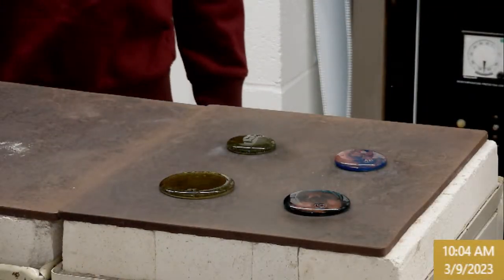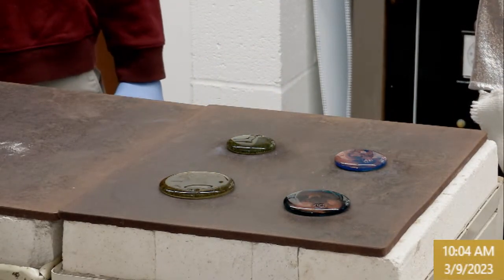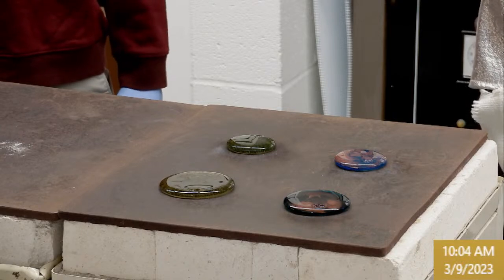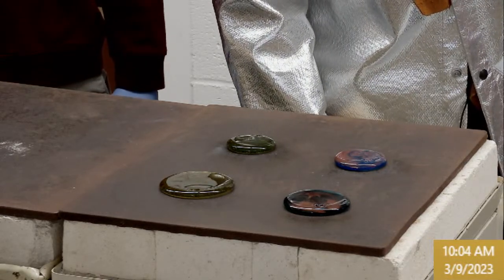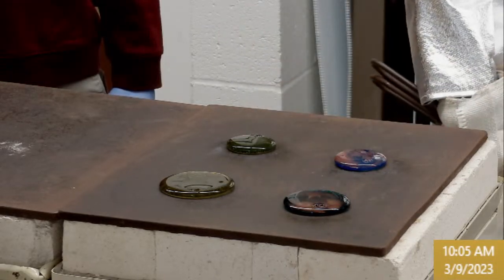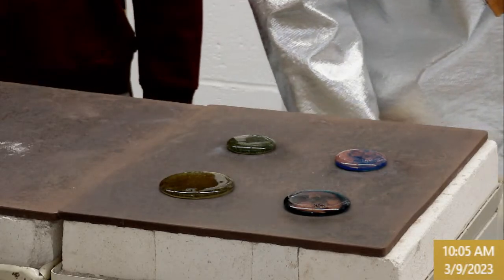Yeah, I was expecting bluish purple, but that one's like, nope. Give it time though. These can change color as they cool. Right now we're kind of looking green. We'll see if some blue purple eventually. Is it changing or not? I think it is changing. We'll keep an eye on that one.